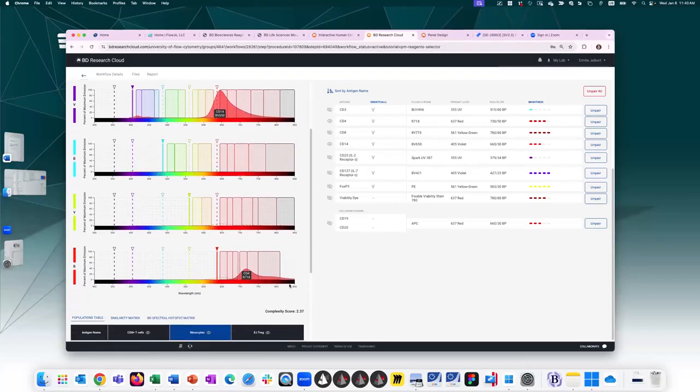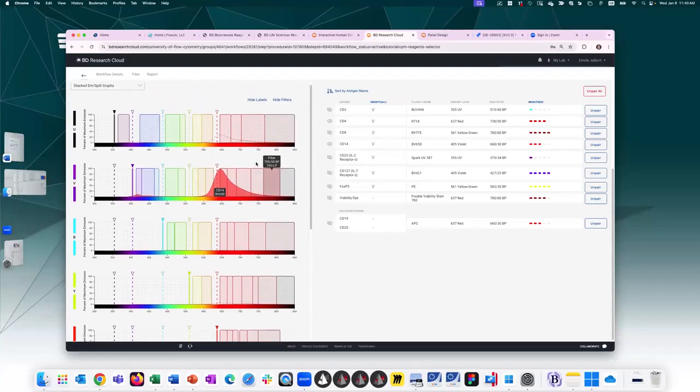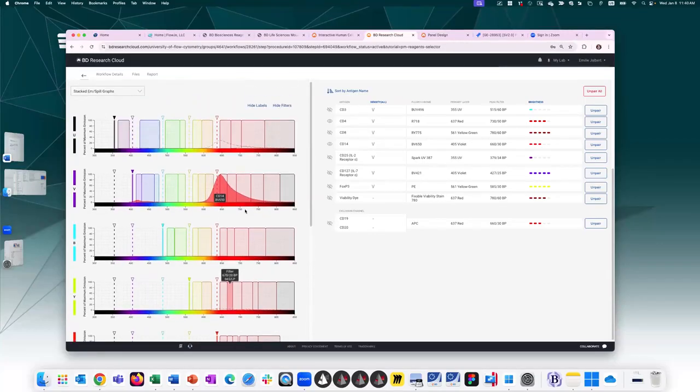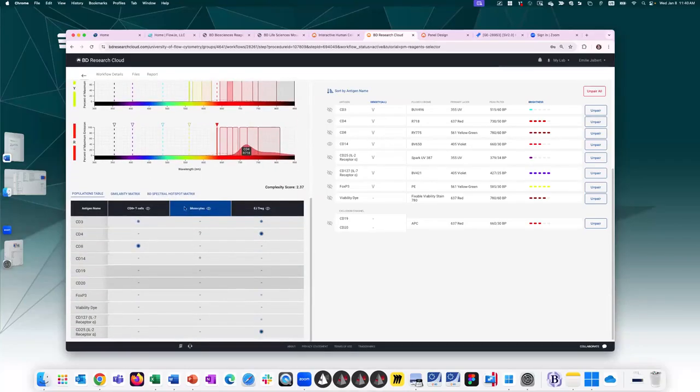And if we scroll down, CD4 is assigned to this fluorochrome, and we'll have very minor, I don't know if you can even see that. There's like a tiny little hump here of this fluorochrome that gets slightly excited by the violet. So I'm not concerned at all by these two fluorochromes being on the same cell type, so I am happy with that. Then I can move on to my other population, EJ-Treg.